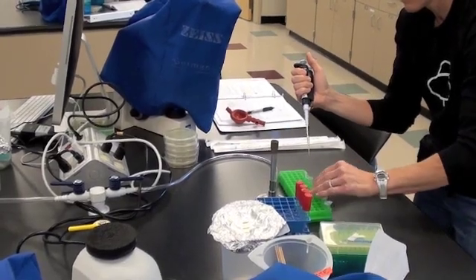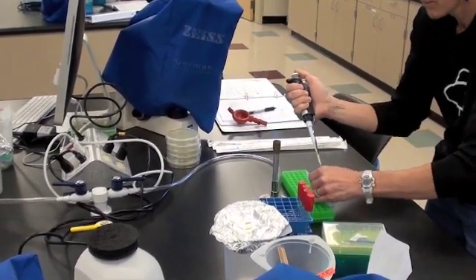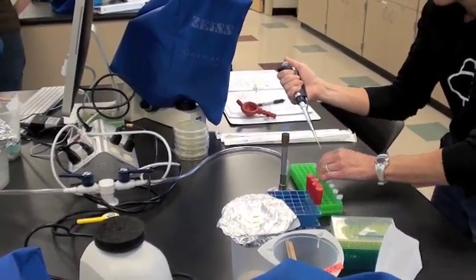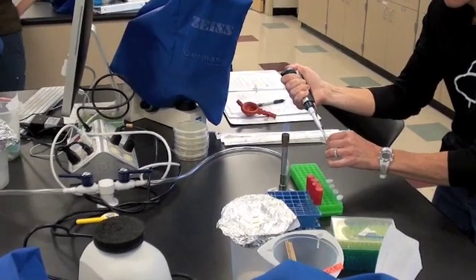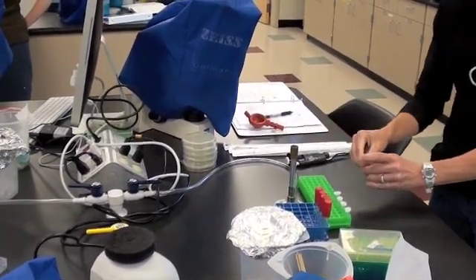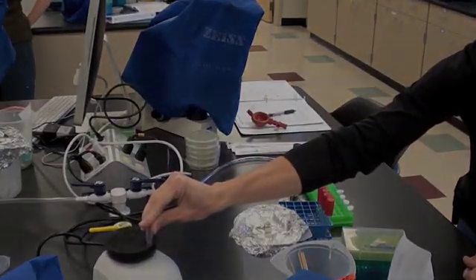We'll watch as she finishes her dilution series. When the student is finished, she'll be ready to infect her Mycobacterium smegmatis cultures with 10 microliters of each of those dilutions. She'll then plate those out and we'll see the results the following week.